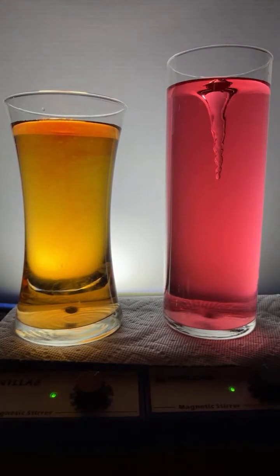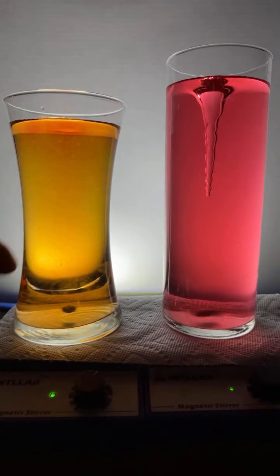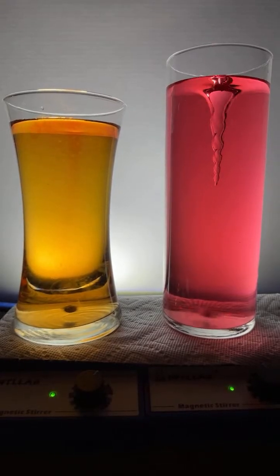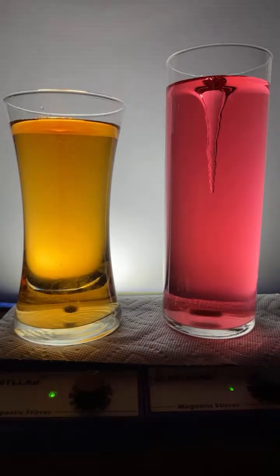Can I mix raw pH 5 with a base? I got to get it to pH 5 first. You know, I think I've got it here. I think I got pH 5. The device that spins is called a magnetic stir plate. All right. So what was the question? We got pH 5. We want to mix it with some base. All right. So we got pH 5 here. Yeah, pH 5. Thank you there, Megan.